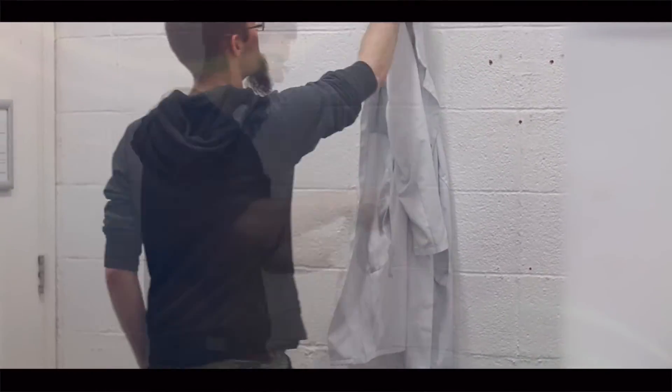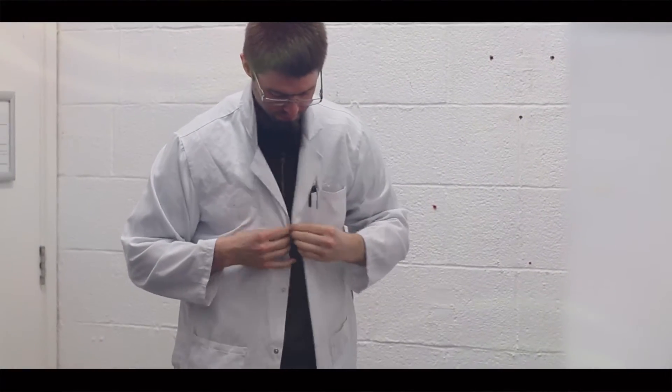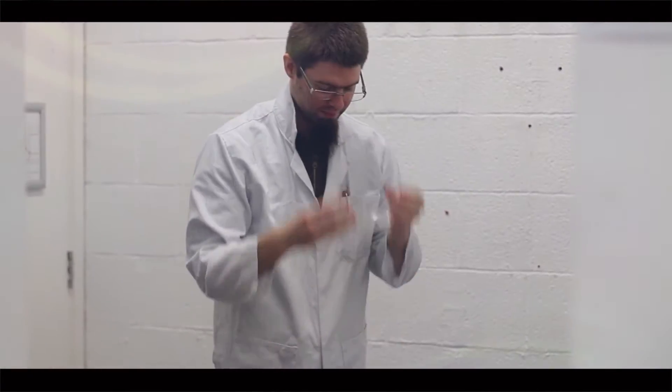Proper protective equipment is absolutely necessary when working in any laboratory environment. Before entering the lab, we need to make sure to put on lab coat and protective glasses.